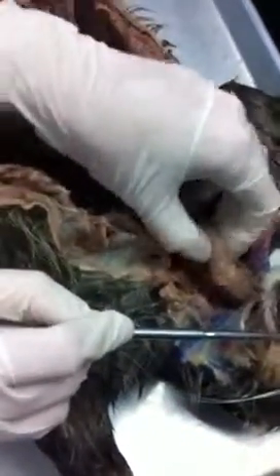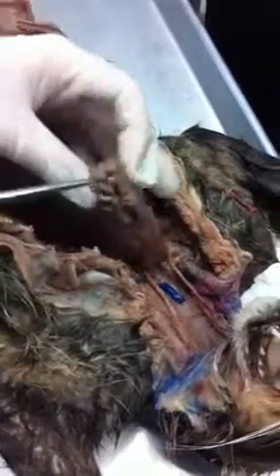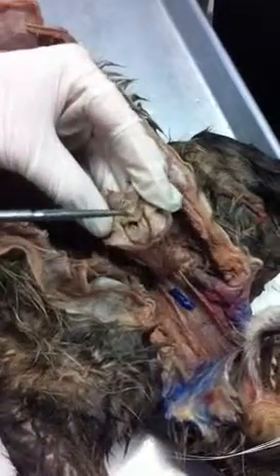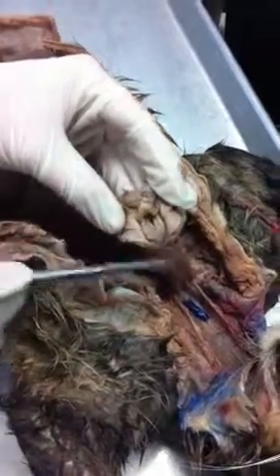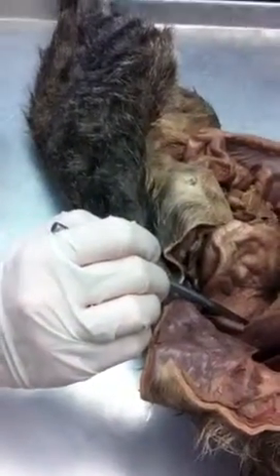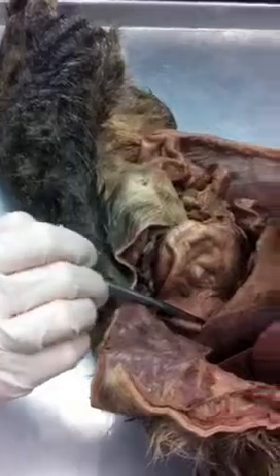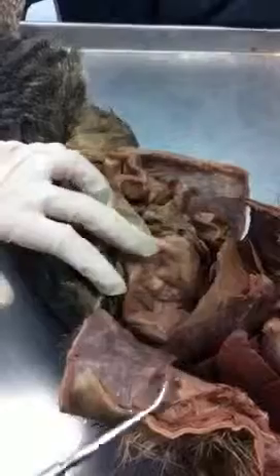We take in food through what cavity? Oral. It goes to the pharynx first, and then it comes down the esophagus. What closes to keep bolus from coming into the trachea? The epiglottis. All right, so now I'm down into the esophagus. I come behind the esophagus, and I come into the stomach through what valve? Cardiac sphincter. Okay, cardiac sphincter, or the gastroesophageal sphincter. That's at the top of the stomach, back in here.